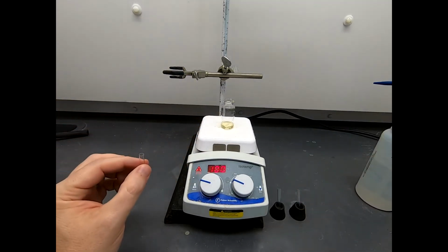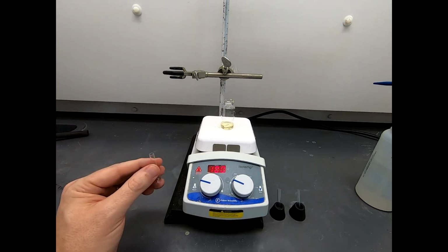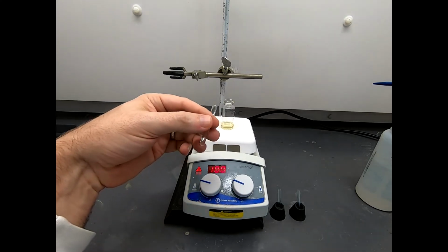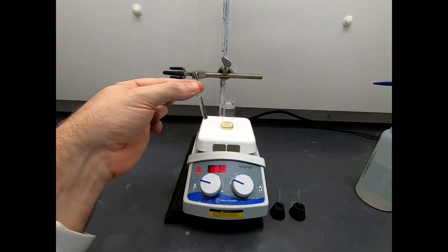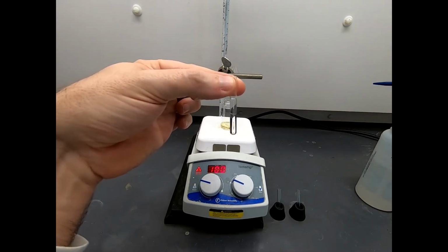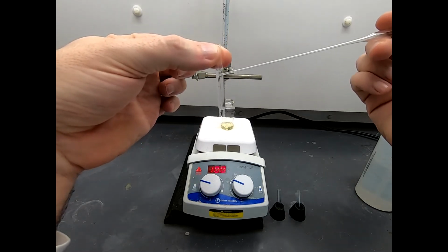So now we have water in here, and now, off camera, I'm going to get a little bit of ether. And I'm going to squirt some ether in here, probably drip it everywhere. That happens with ether sometimes. And now you can see, maybe you can or can't see, there is a bottom layer. I'll try to hold it closer. There's a bottom layer that's water, more dense water, and the top layer is ether.